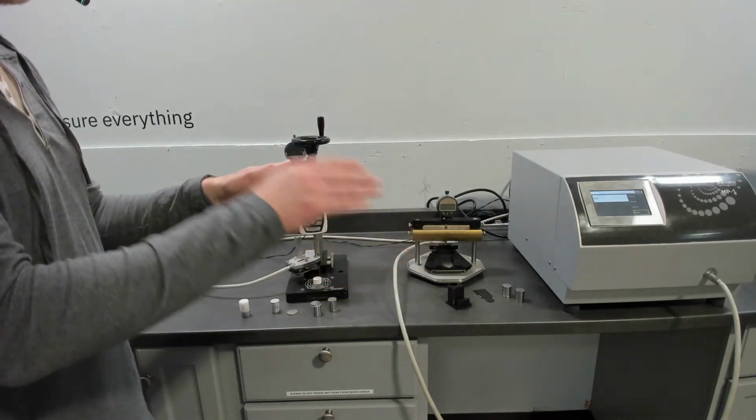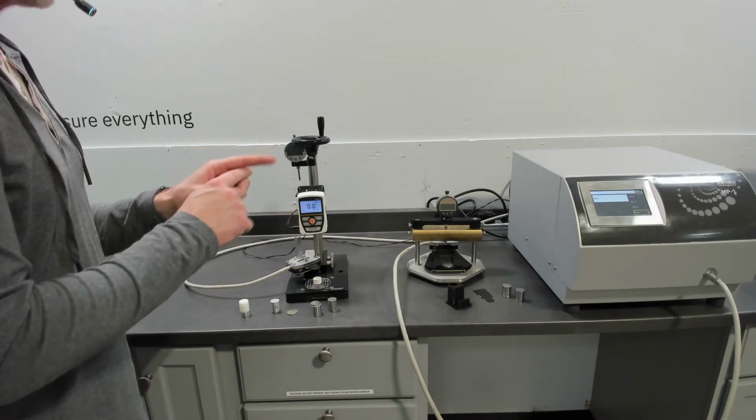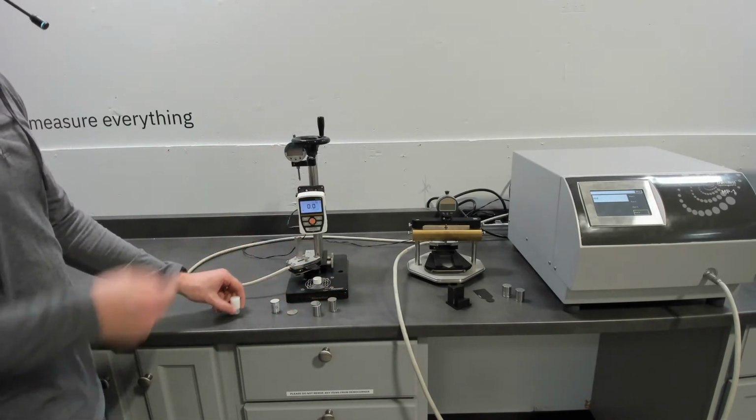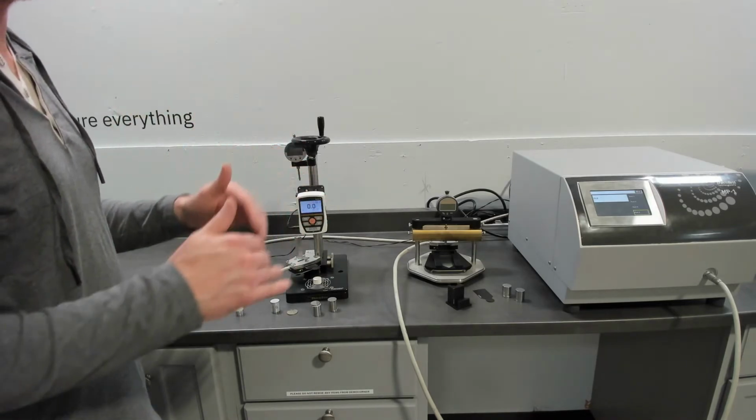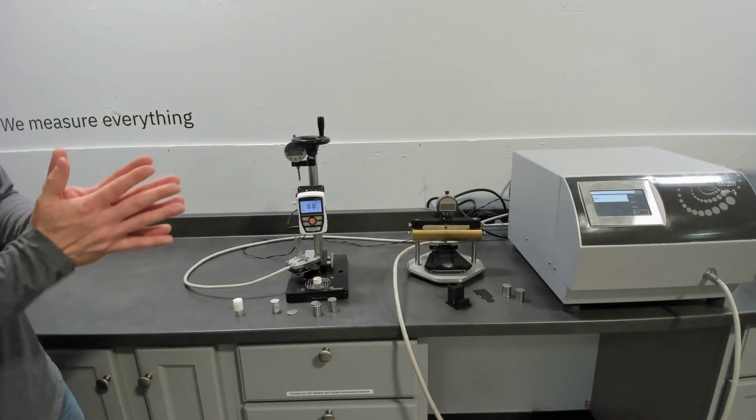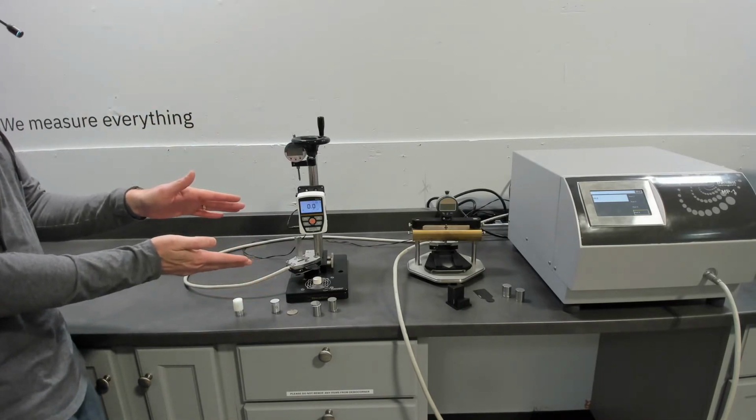So we have a curve of a variety of pressures on the same material. And then we have some data on dissimilar materials with different surfaces, and you can see how they trend in terms of thermal resistance. Why is the thermal contact resistance between 2 objects important?